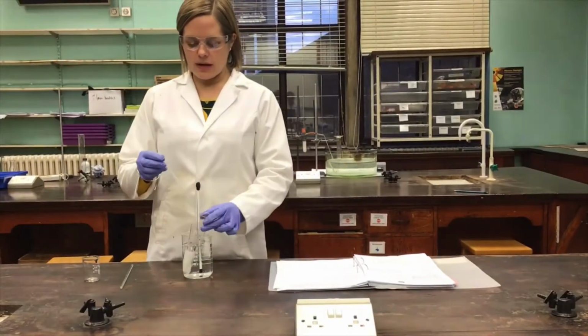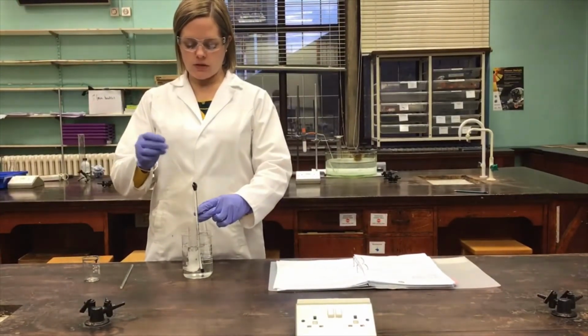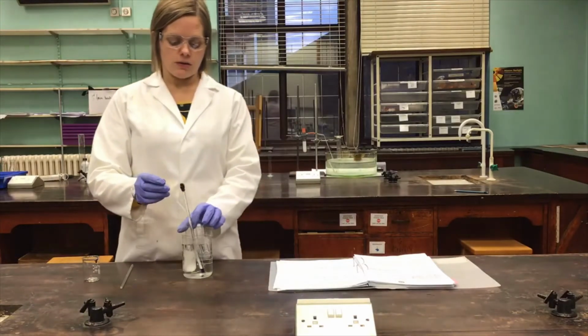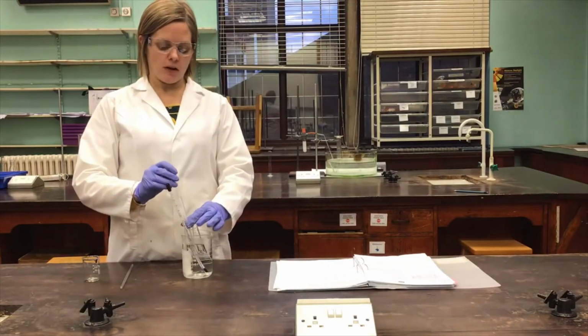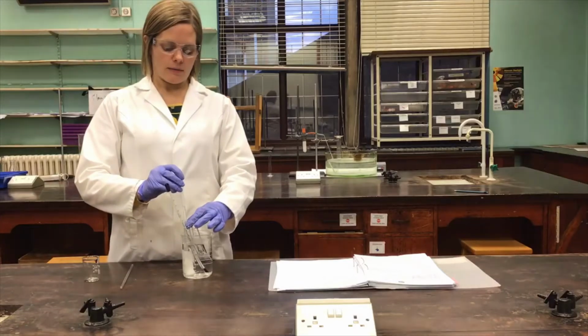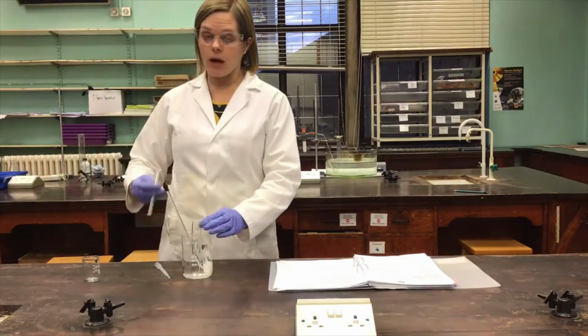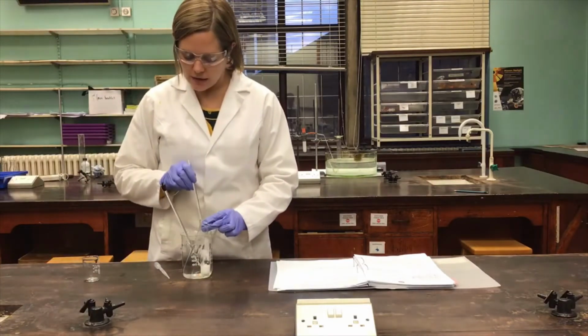So the ethanol has now warmed up nicely in this tube, so I'm just going to add it very carefully and very gradually to the crude aspirin in the other tube. I'm going to try and maintain the temperature as I'm doing this, because remember it's important to add the minimum volume of the hot solvent to dissolve this aspirin.